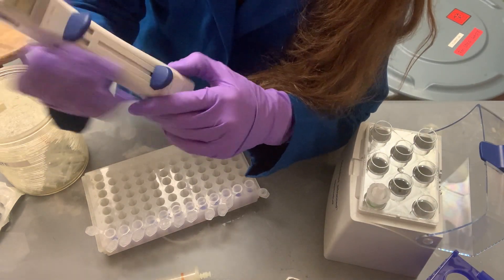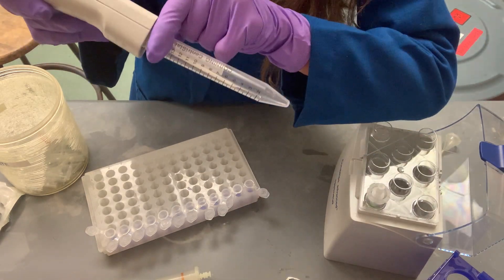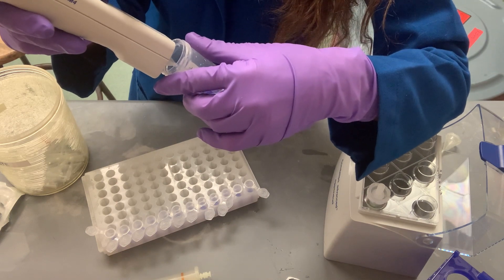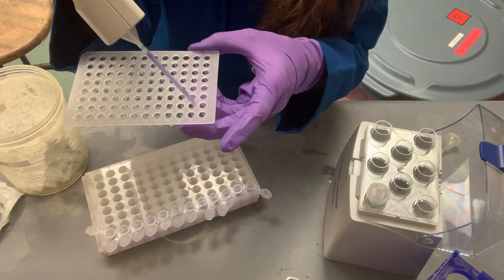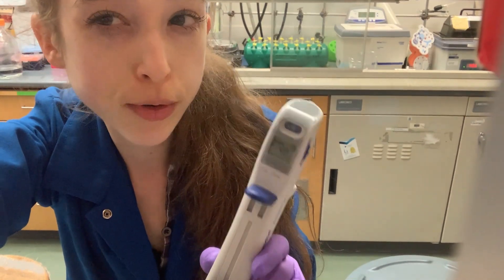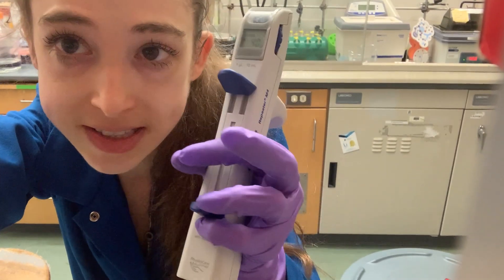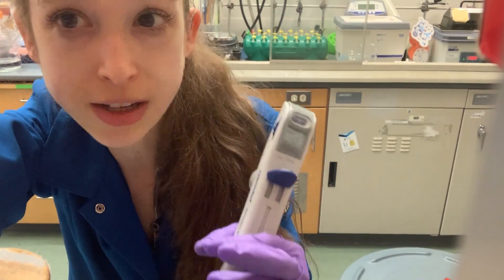If you wanted 40 µL aliquots, be strategic about your source container — the tip won't fit all the way into some tubes. Pull up, skip that first dispense, and then pipette into each well. With small volumes, be really careful that liquid is actually coming out. Pipette onto the wall of the tube and visually confirm the drops. With tiny volumes, liquid can bead on the outside of the tip instead of going into your sample.